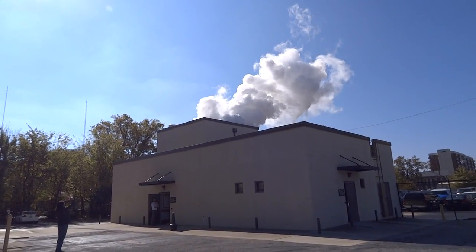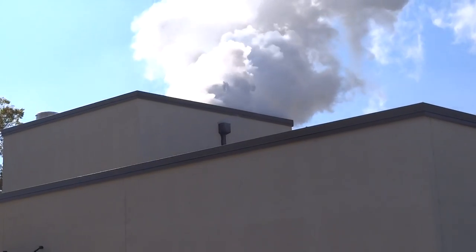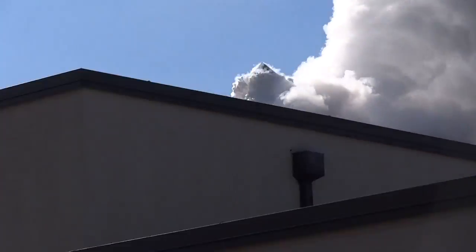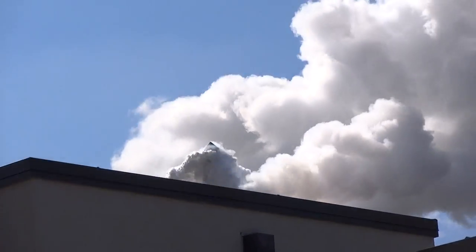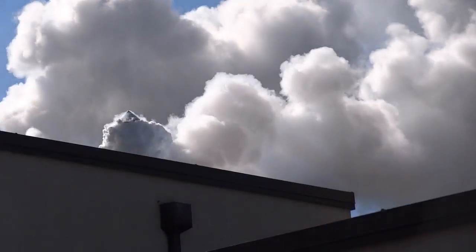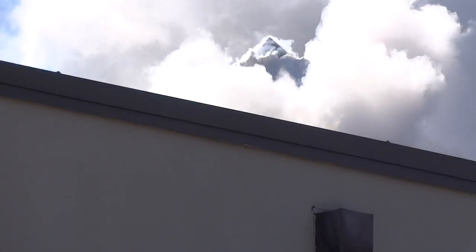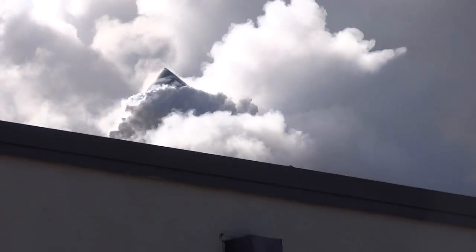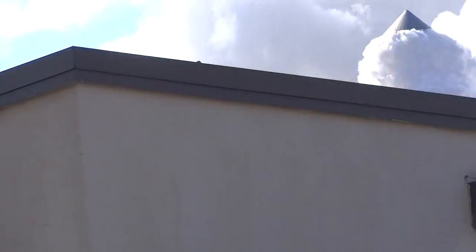I don't think it's working, guys. We got a secondary flow. Secondary what? It's almost coming out of that other little thing. Cloud machines. Really? What? What's happening inside? It's a little hazy in the room. Oh, dear. Be in there? Oh, we'll all be speaking in a very high pitch now.